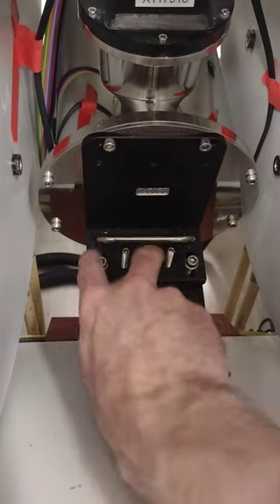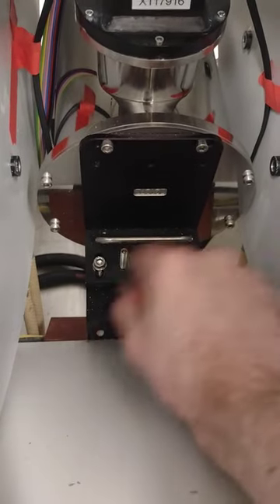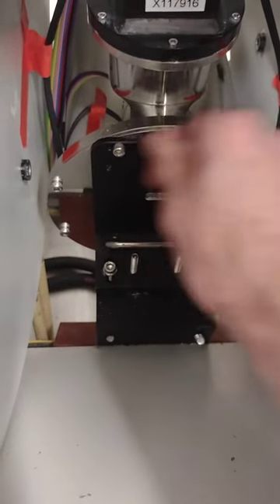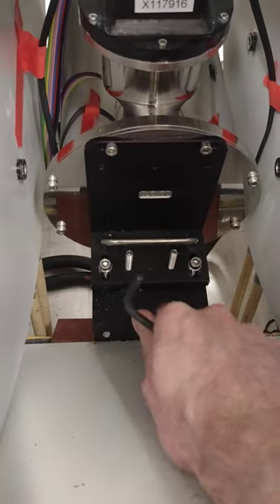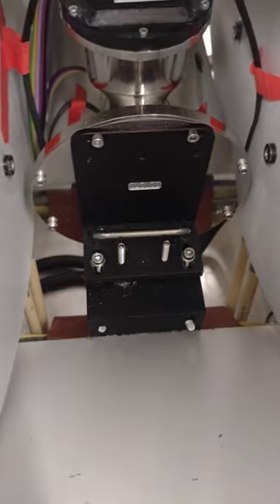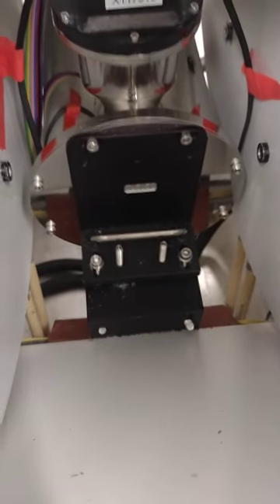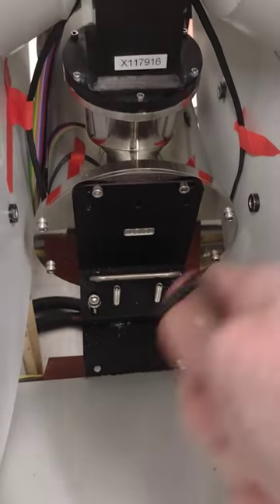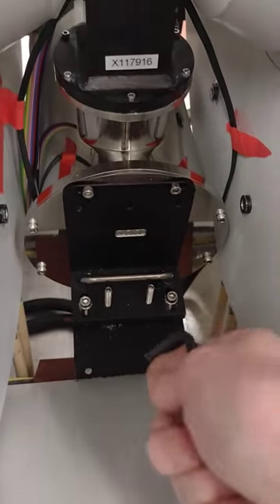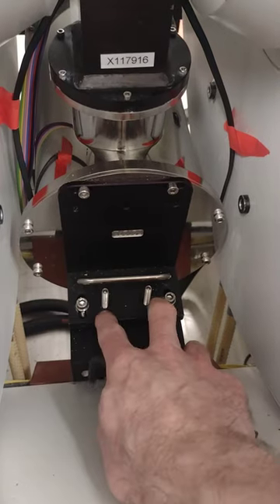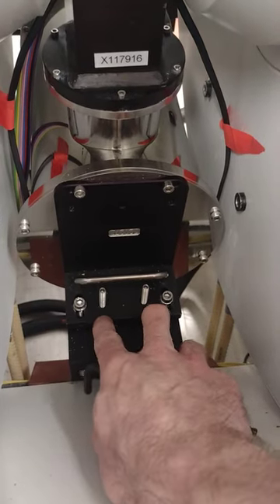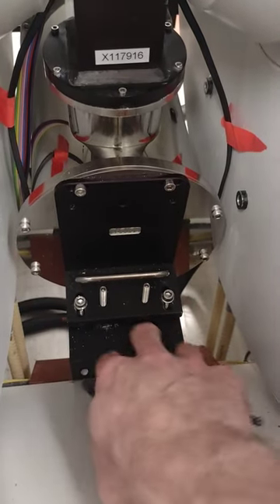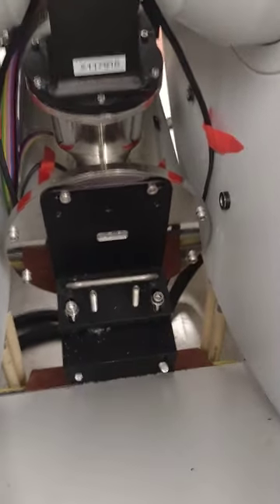I'm not going to do that because I'm not removing the cryostat today, but you remove this one, you remove this one entirely. If you want to keep a grad student just sitting here making sure that this thing doesn't fall over, you can, but usually it's heavy enough that it'll just sit here and it won't move until you're ready to move it.